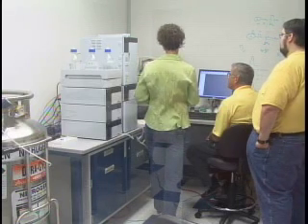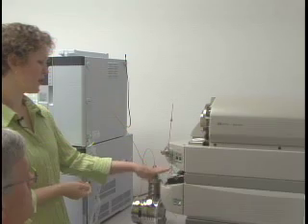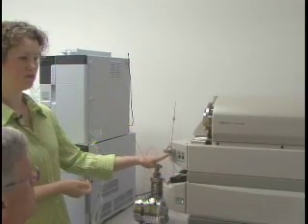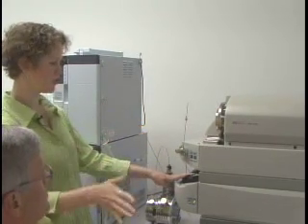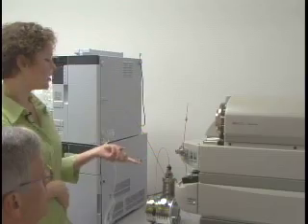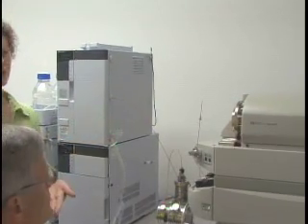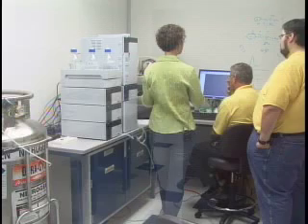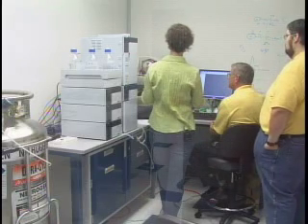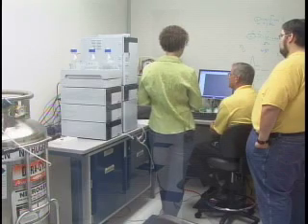This piece of hardware is also equipped with a syringe pump commonly used for infusions and the tuning and optimization parts of running the instrument, which we'll get to later. There's also a diverter valve — some people use that if they have a particularly dirty sample and don't want to contaminate the instrument, so they divert some of the sample to waste before introducing it into the mass spec side.